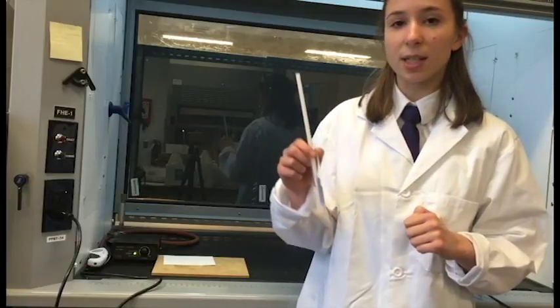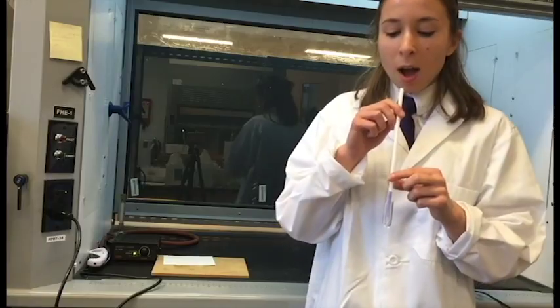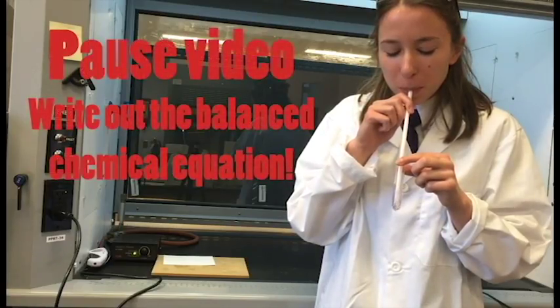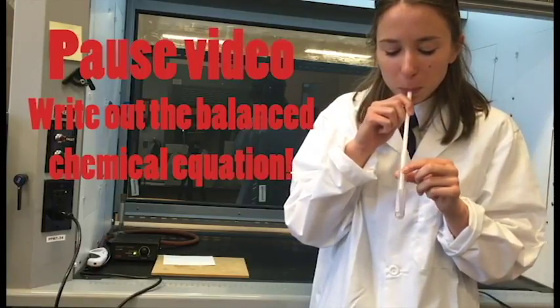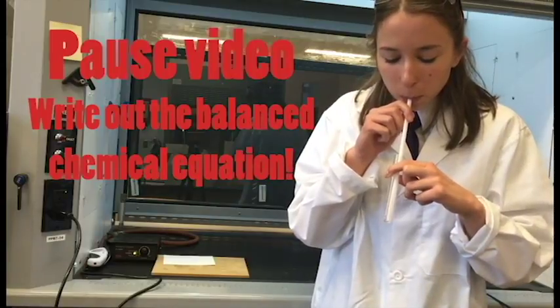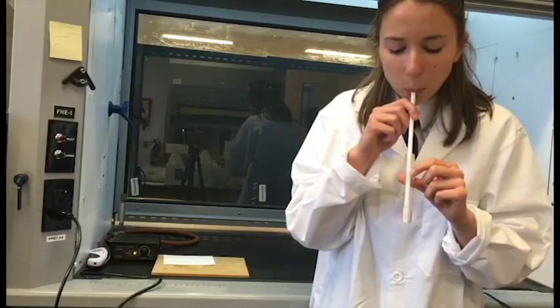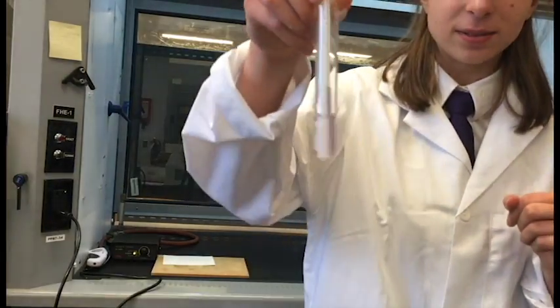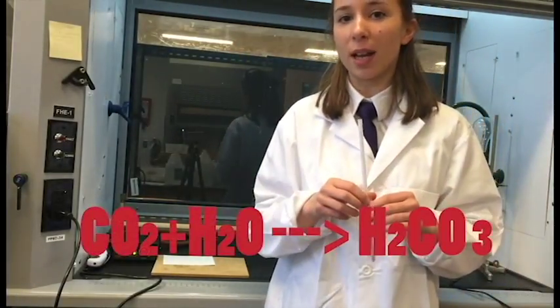Okay. Now we're gonna bubble CO2 in distilled water to form carbonic acid. There, you can see that it's now pink. And so since the litmus paper is pink, now we know that an acid was formed.